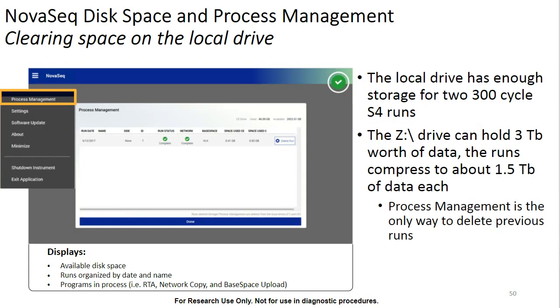So talking about process management, if we do need to clear space on the local C or Z drives, like I said, this can only be accomplished using the process management tool that is part of the control software. So to do this, open up the drop-down menu in the top left and then select process management. From here, we can safely delete previous runs that have completed transferring to our permanent storage location. The C and Z drives are designed to hold up to 2 S4 300 cycle runs. So depending on which size of runs we are performing, your mileage may vary on how many runs you can fit on the instrument, but we do recommend routinely going through and removing old runs that have been successfully transferred.